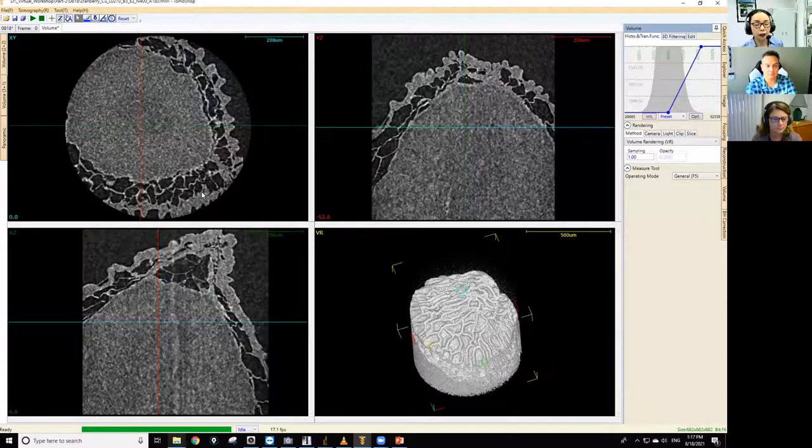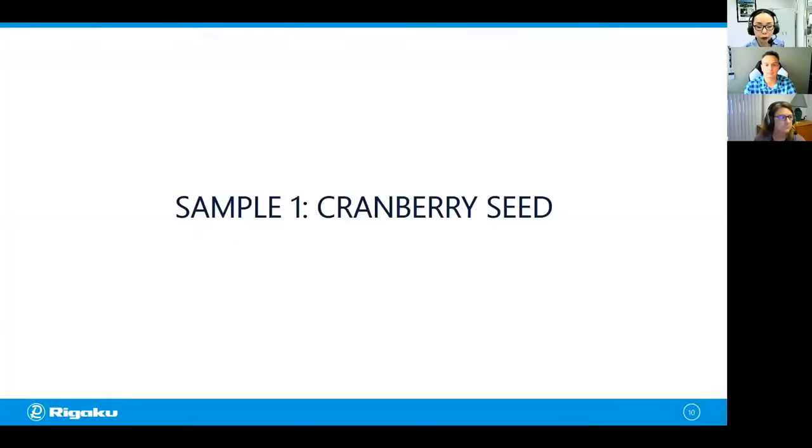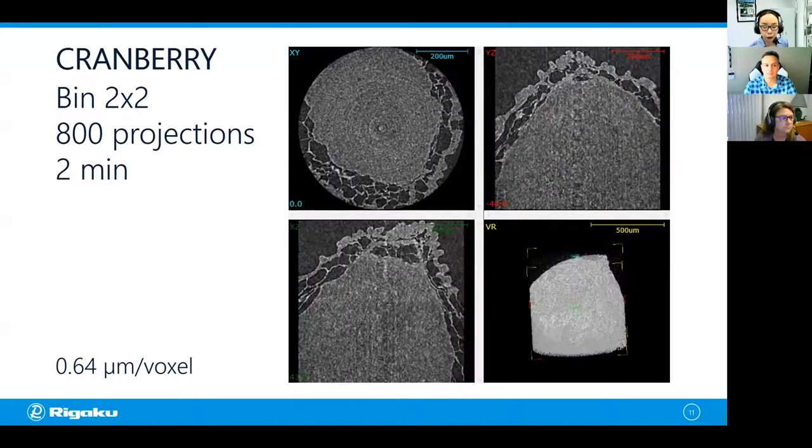Now, let's take a look at the other two scans collected under different conditions to see what kind of difference we'll see. So we're going to switch to the PowerPoint screen again. Okay. So if you use binning 2x2, your voxel resolution is 0.64 microns. So that's a higher resolution. But this looks a little bit noisier than the one we just did, because to collect the 800 projections in 2 minutes, you're reducing the exposure time per projection. So that makes the image a little bit noisy.